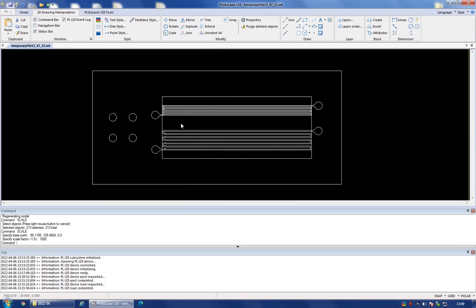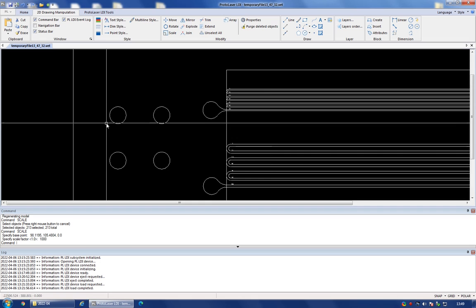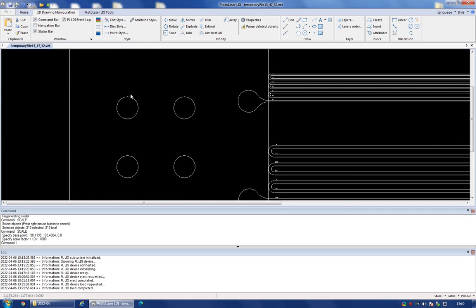So the way that the software works is that you have to provide it some enclosed shape. So any enclosed shape, which is delimited by a single line, can be converted into an area that the laser writer will expose. So for example, these circles that I've put in here, which are some practice inlets for punching in the PDMS, I can select this, and you can see that this is one single enclosed shape.